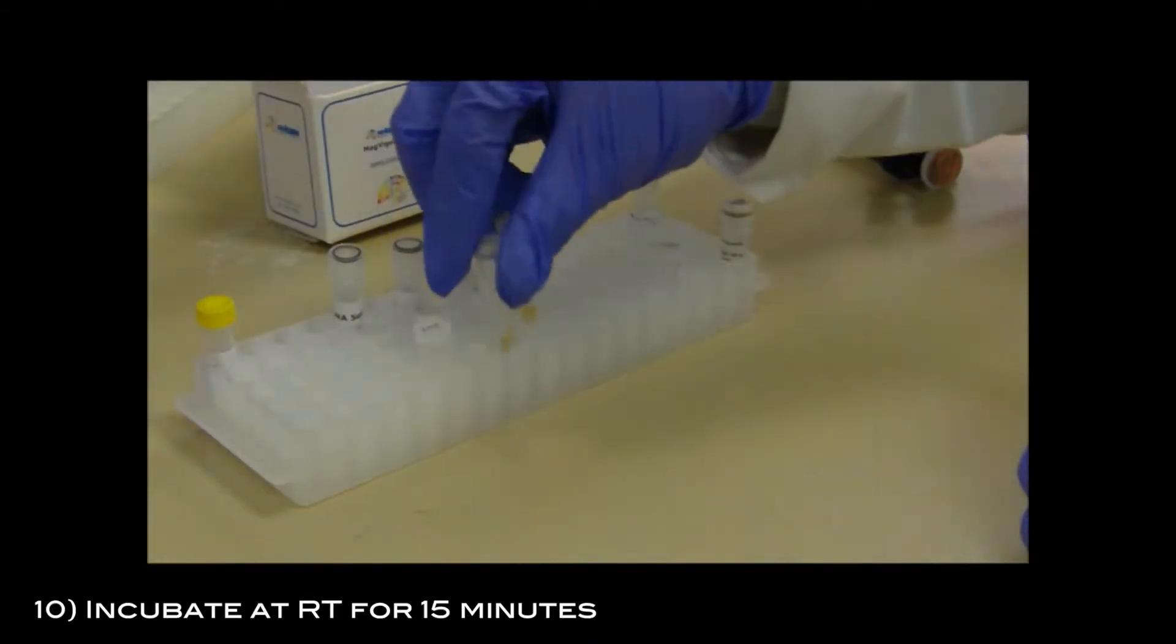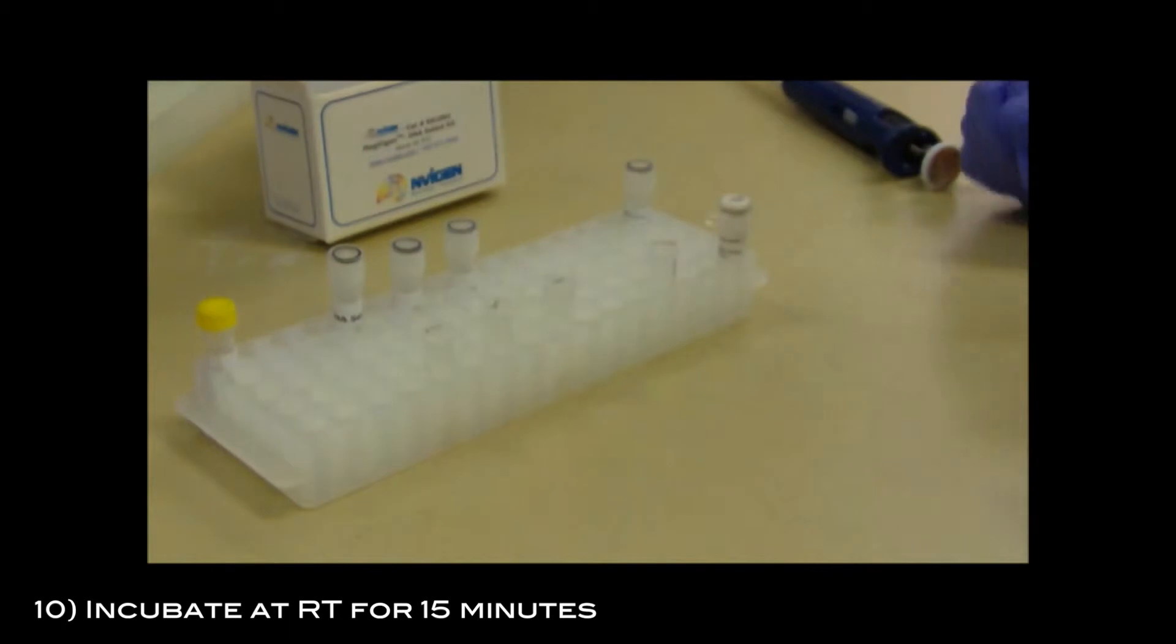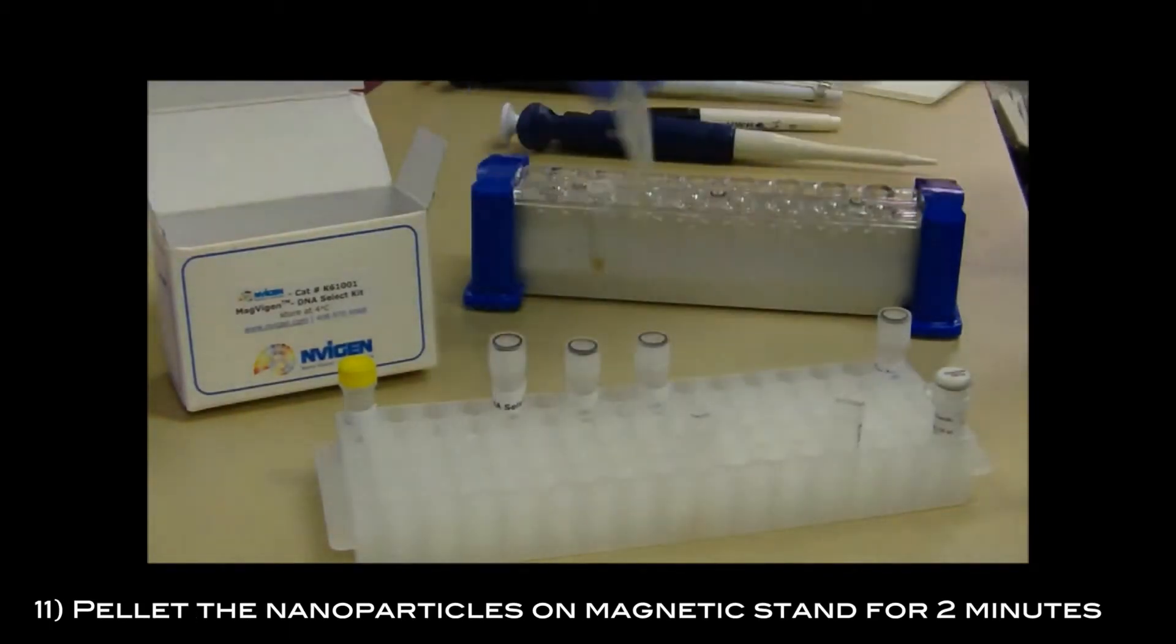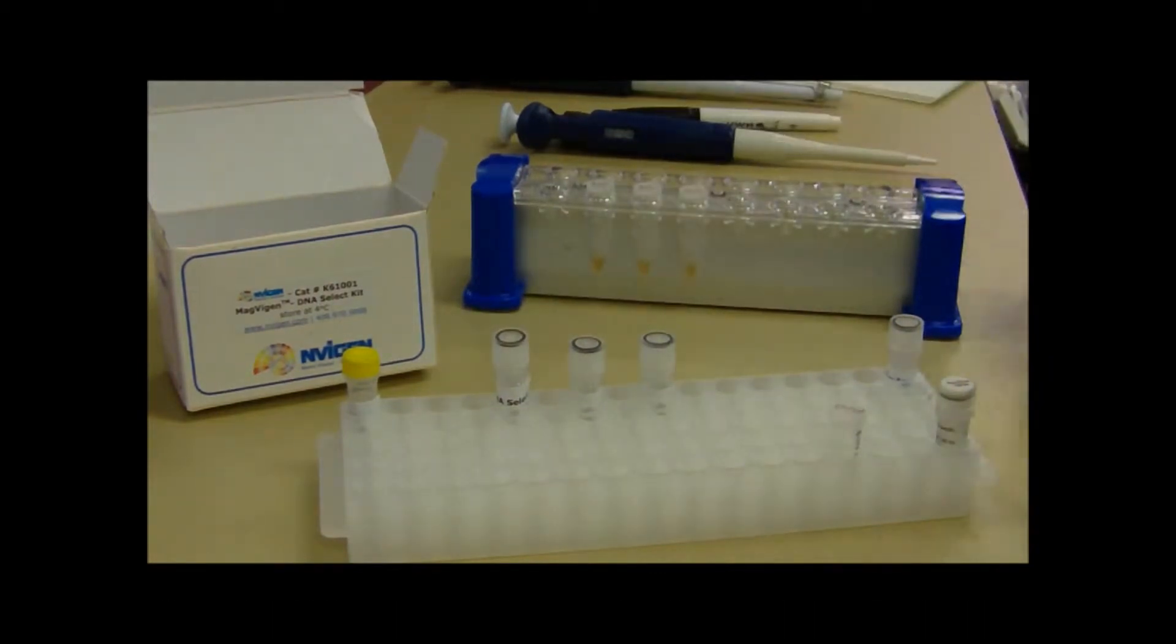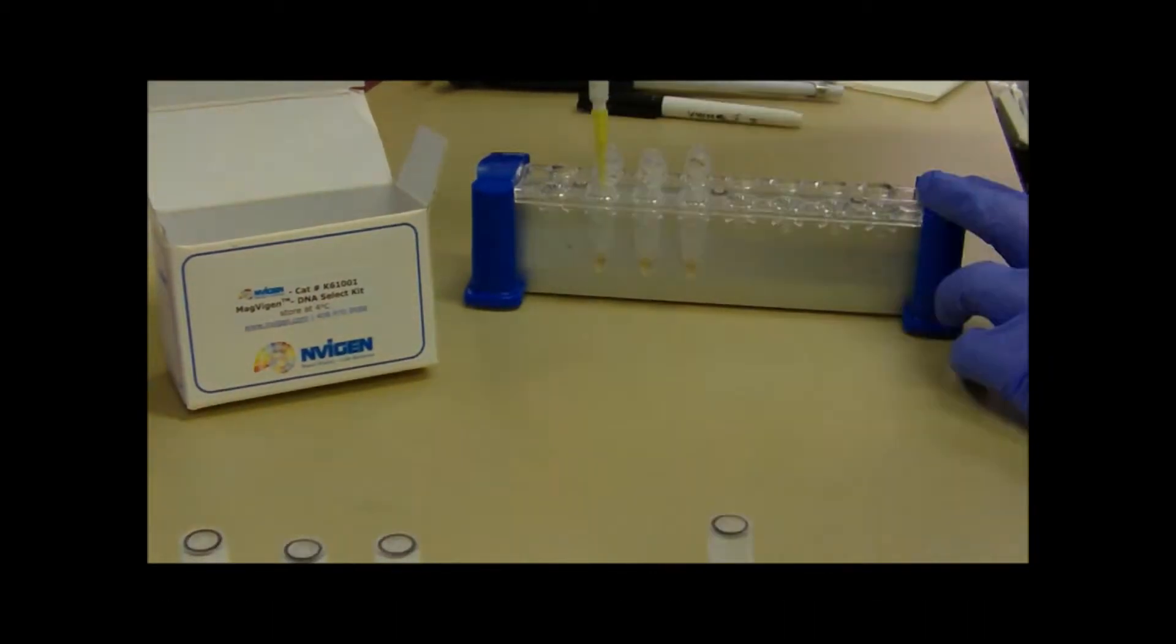Incubate at room temperature for 15 minutes. Pellet the nanoparticles on the magnetic stand for 2 minutes, then remove the supernatant.